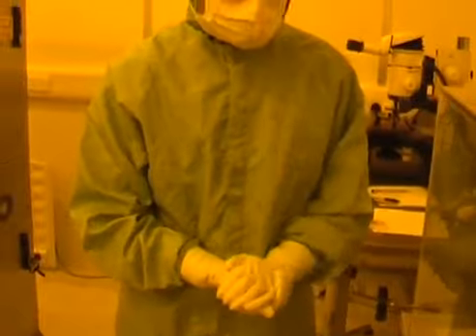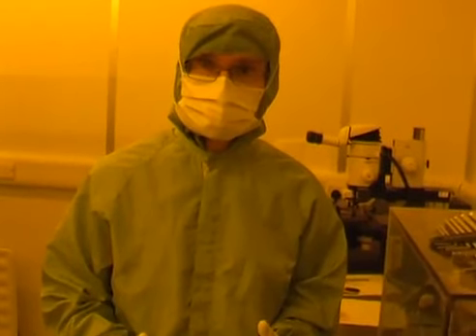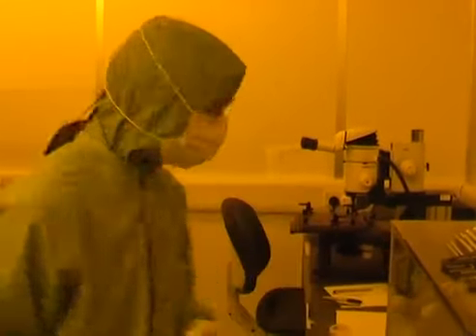The first stage in the process is to work out which holder to place the sample into. And to do that, I need to look closely at the job submission form and see what the sample thickness is and any special requirements.